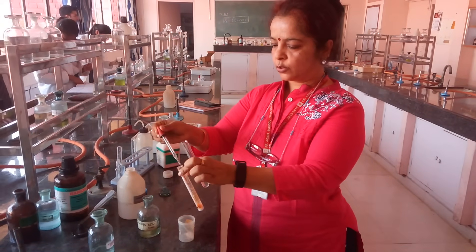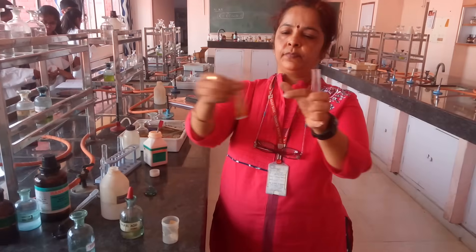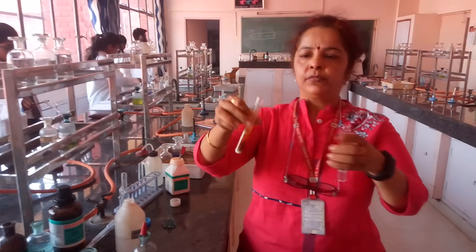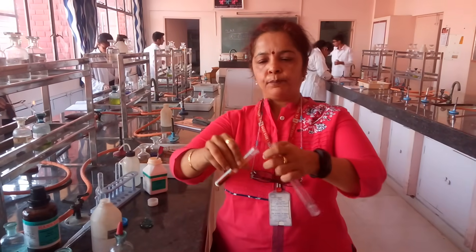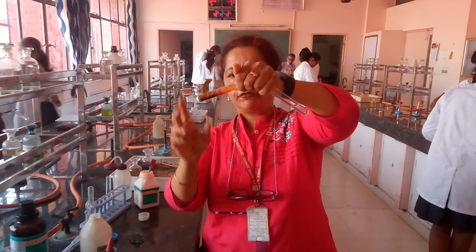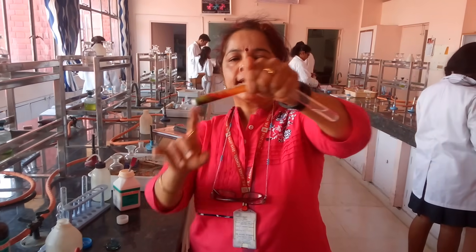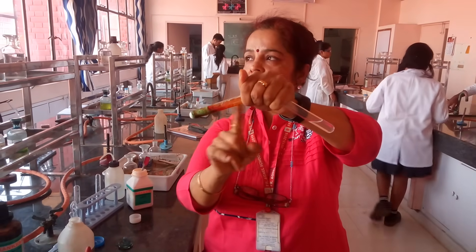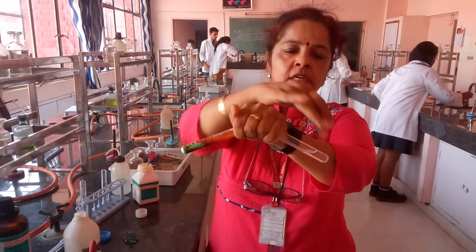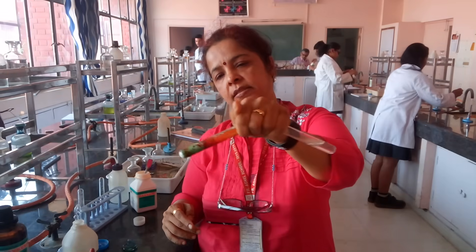The test is now underway — we have concentrated sulfuric acid added. The gas coming out is reddish brown in color; this is your chromyl chloride gas. Pass the gas through the NaOH solution. It's a rough way of doing it, but it works. You can see the dense reddish brown colored gas on your right.